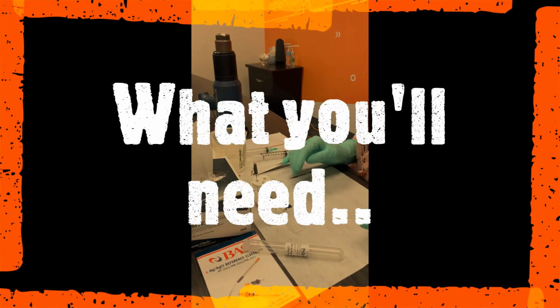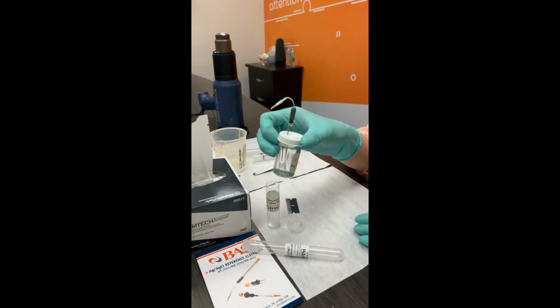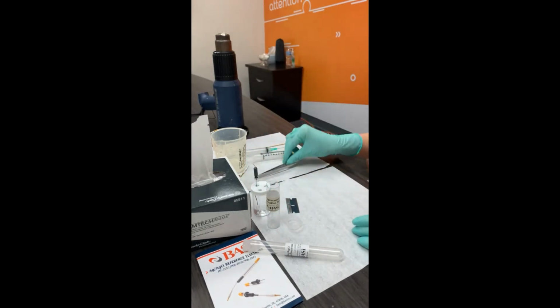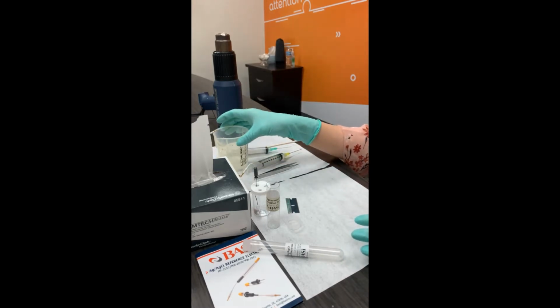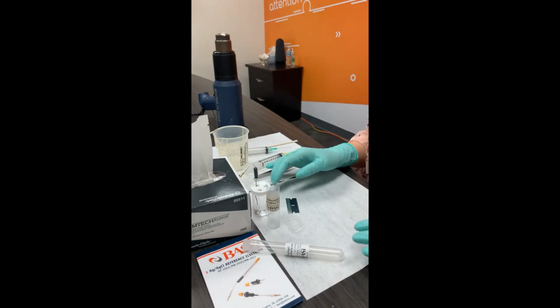Now in order to do this, you're going to need a piece of blade, your replacement CoralPor tips, your storage vial that has your saline solution. It could be your sodium chloride or your potassium chloride depending on what you're using, a tweezer, syringe needles for the refill solution, your waste beaker, and your heat gun. Now, if you don't have a heat gun, you can use either a blowtorch, a lighter, or even a Bunsen burner if you do have access to one.